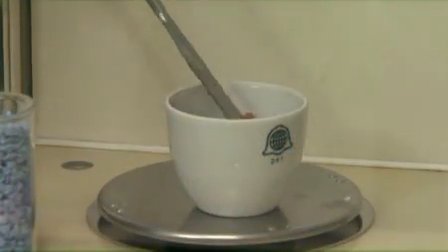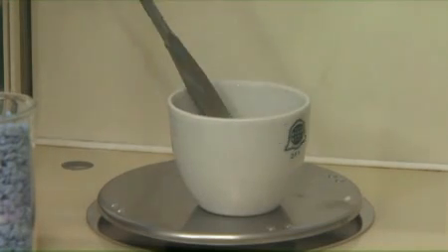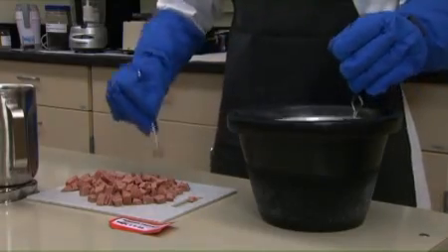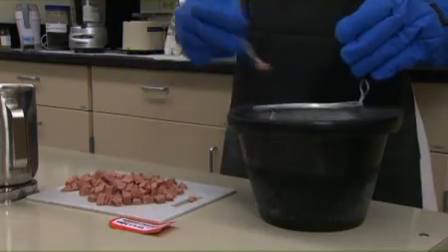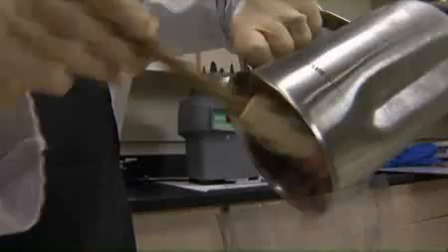Sample preparation is an important step for ensuring the homogeneity and suitability of the sample to be representative for the analysis. Before a sample can be analyzed, it must be properly prepared so that an accurate test result can be obtained. The goal of this sample preparation method is to generate a mixed sample that is homogeneous, uniform, and finely divided to yield a large surface area.